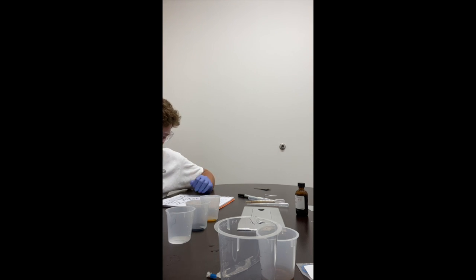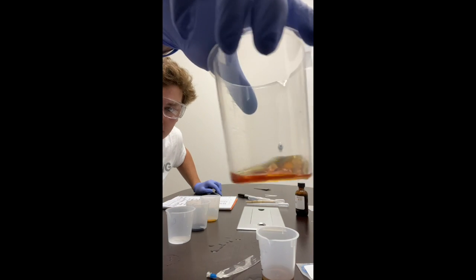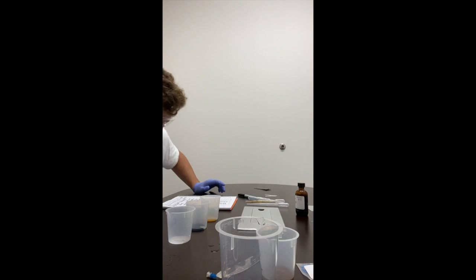And after 60 minutes, we tested it with a glucose strip and it was yellow with a little bit of green on it. And then whenever we added the IKI, it's an orange. We'll put orange on there. We have the orange. And so those are my results.